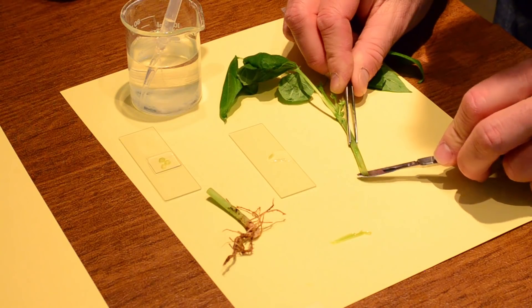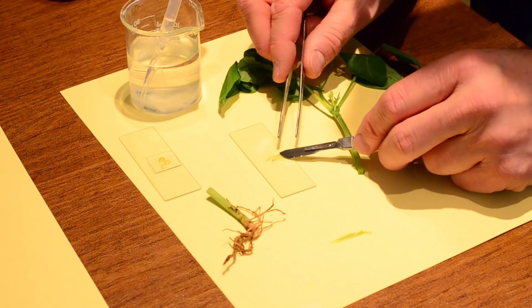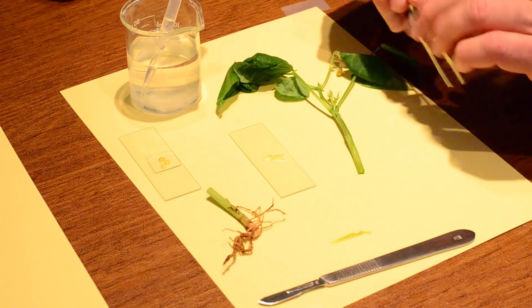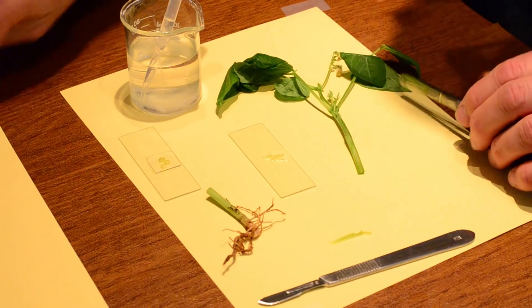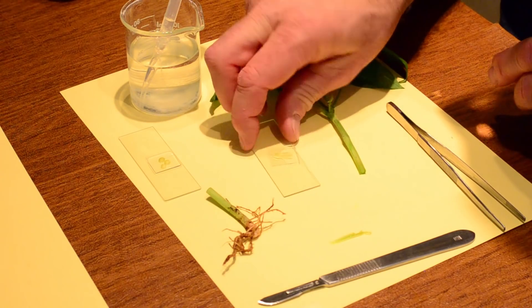Ah, perfect. Now I can see some different tissues. And they're going to be arranged differently, right? So I'll put down my scalpel. And I would get my cover slip. And put that down. And I'm ready to go.